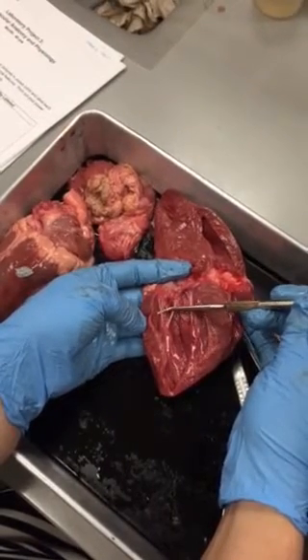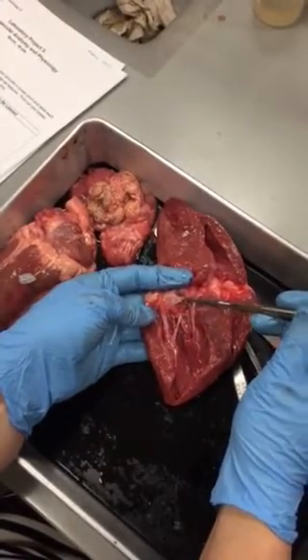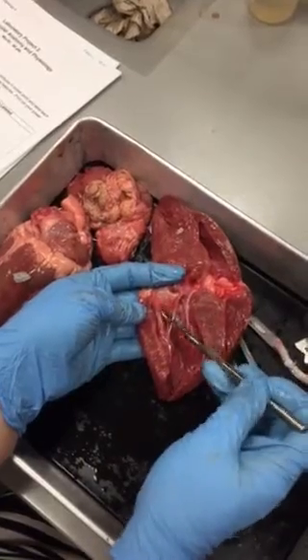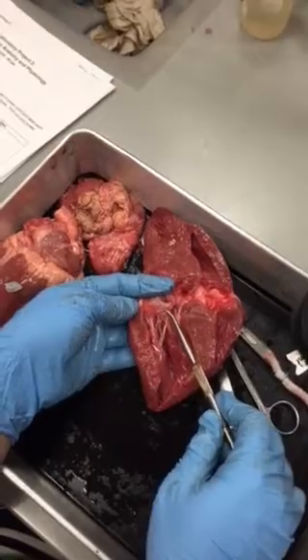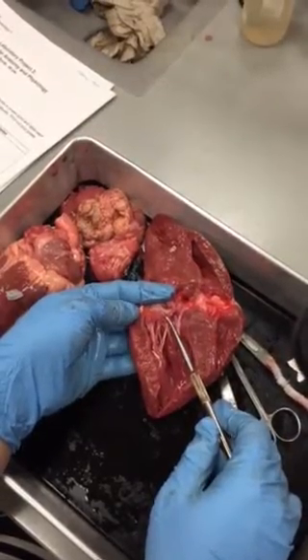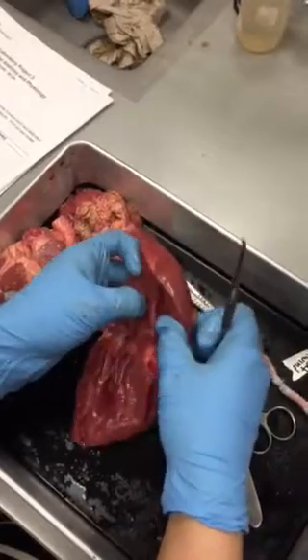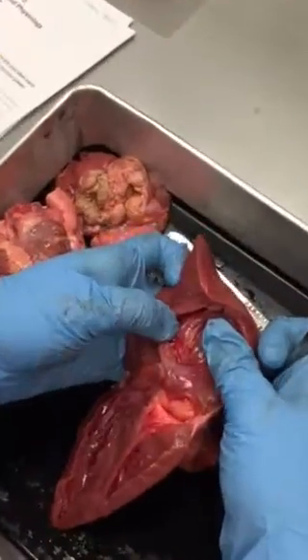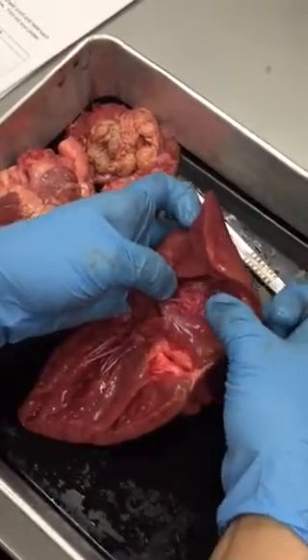Papillary muscles attached to the chordae tendineae. And then the chordae tendineae on the other side are attached to a flap-like structure. And that flap-like structure is going to be one of your valves. Okay? So you have a valve in each chamber. You can see the one for the right side is buried a little deeper in here for this one, just because of how the cut is. Okay.